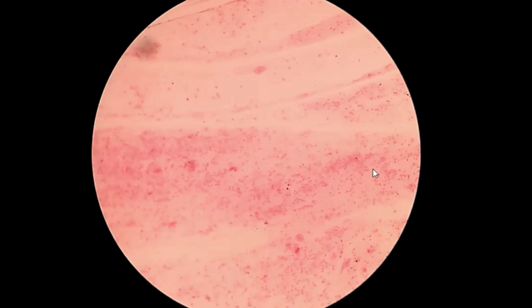And here you can see this one is a small size, these are pus cells. So the number of pus cells is greater than 25, there are so many pus cells, isn't it? And epithelial cells less than 10. So the sputum is ideal or suitable for culturing.